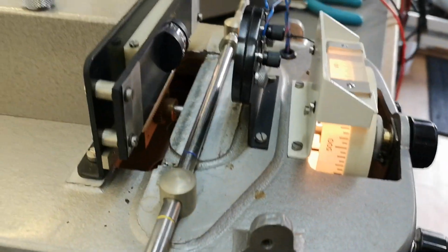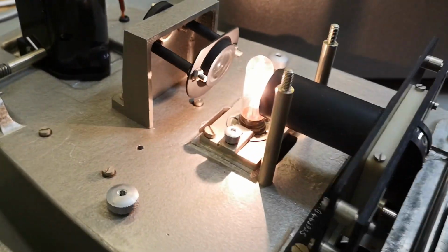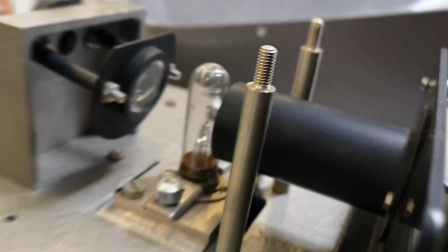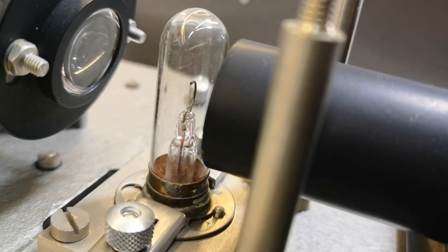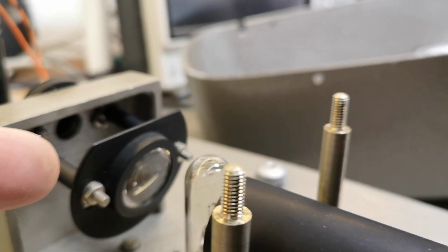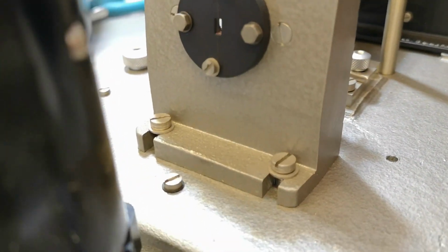And then also got a little light bulb in here probably. Yep, it is down there. Let's have a look in here. Oh, that is a... Okay, I have to turn off the light bulb because that is really, really bright. Oh yeah, as you see, it's actually a special light bulb. The way that the filament is made like that, so it can actually make this nice line for the indicator. We've got some optics here, and you can't really adjust anything. So that's just the way. Maybe there's a focus here. No, that's just the line you create.